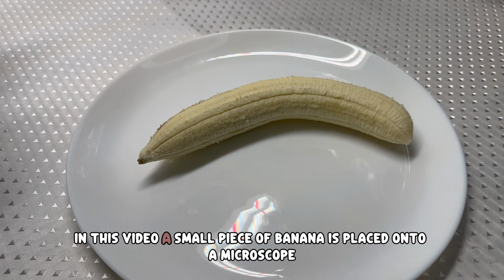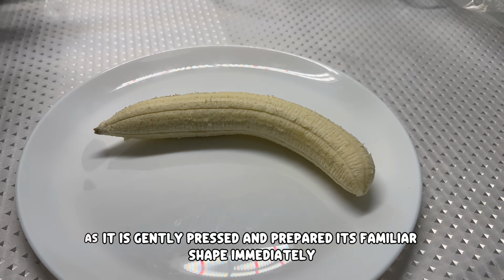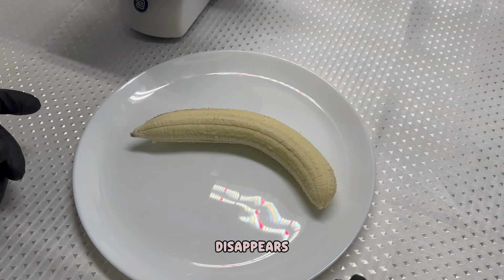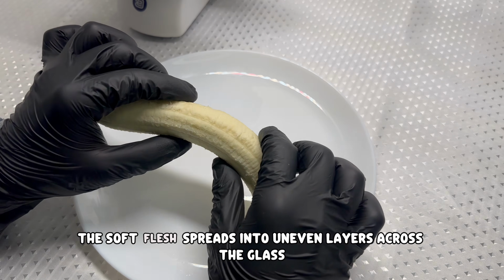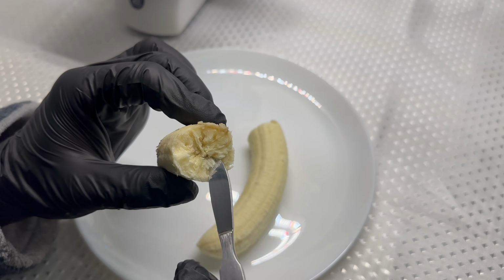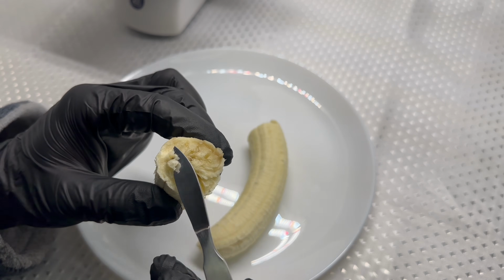In this video, a small piece of banana is placed onto a microscope slide. As it is gently pressed and prepared, its familiar shape immediately disappears. The soft flesh spreads into uneven layers across the glass. What once felt smooth now becomes irregular and textured.